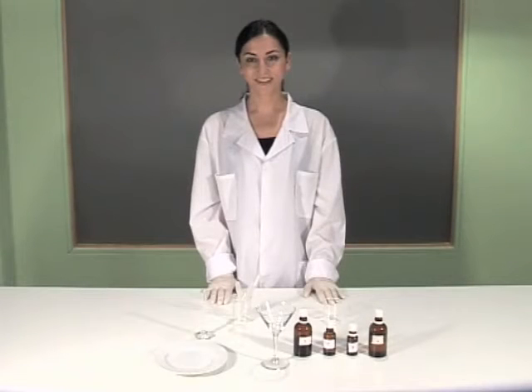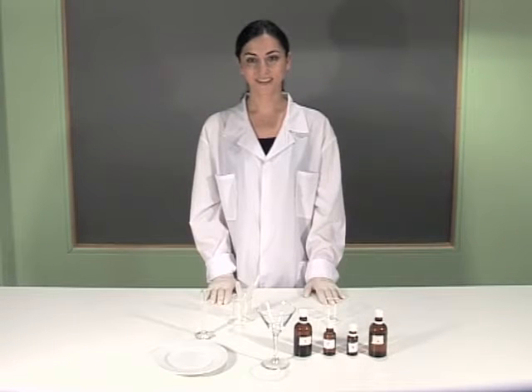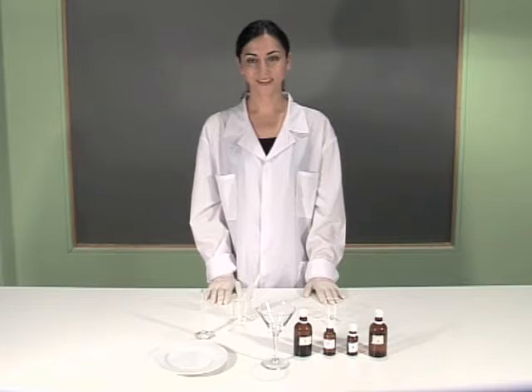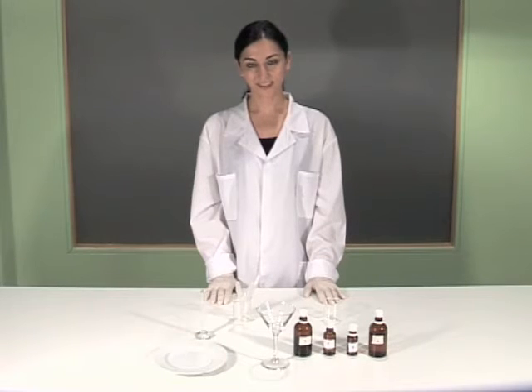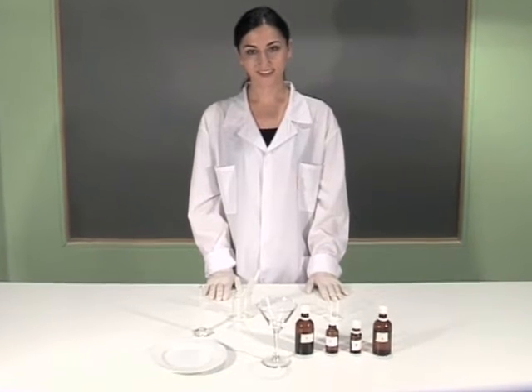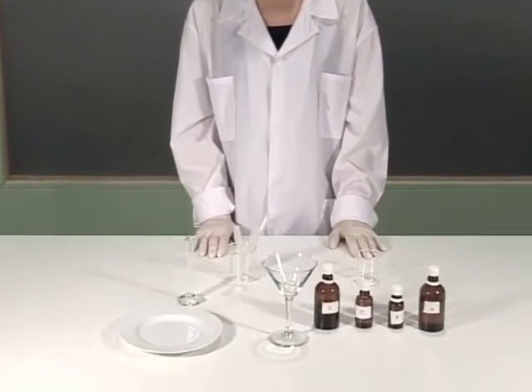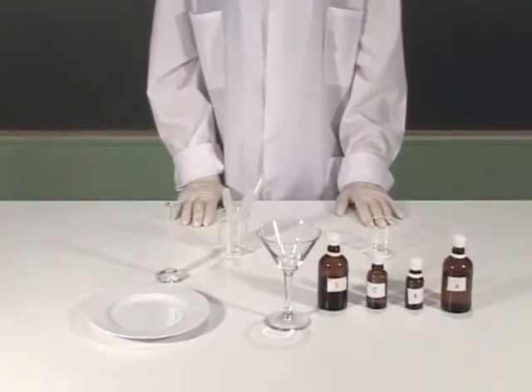Chemical clock. We are about to demonstrate how a quite complicated solution changes colour in a repetitive way, thus functioning as a chemical clock. The chemical reaction responsible for these fairly even colour rotations is known as the Belousov-Zhabotinsky reaction.